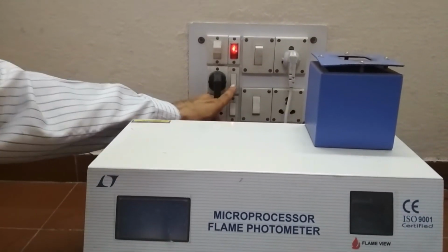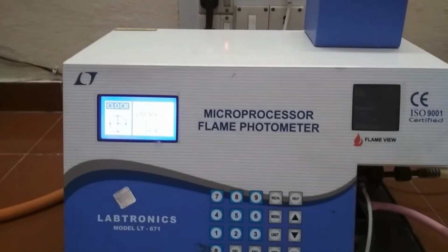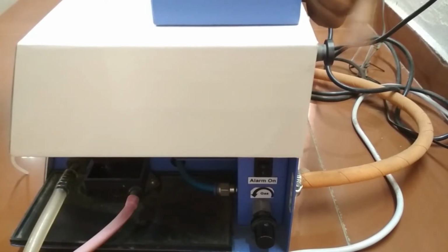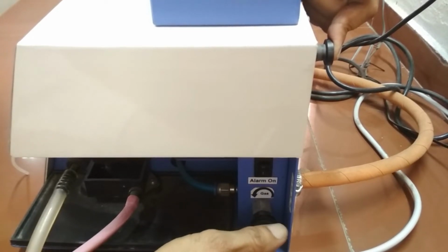Now switch on the flame photometer unit. Switch on the flame failure switch to enable the flame failure indication alarm. Press the auto ignition switch and keep it pressed. Turn the fuel gas regulator of the instrument anti-clockwise slowly. The element comes on the top of the burner and turns red. The gas lights up. Adjust the fuel gas regulator to get silent flame close to the burner with sharp blue cones.